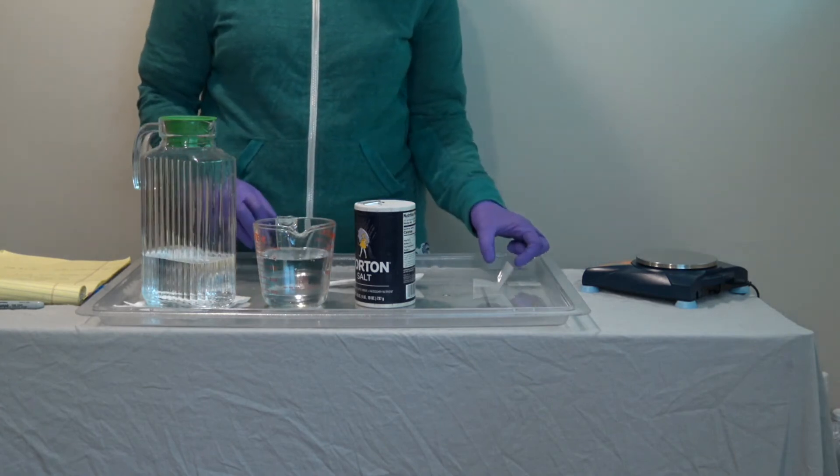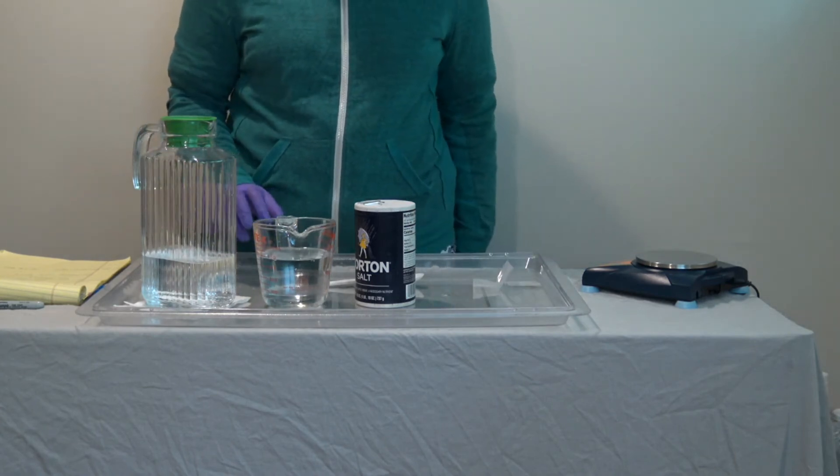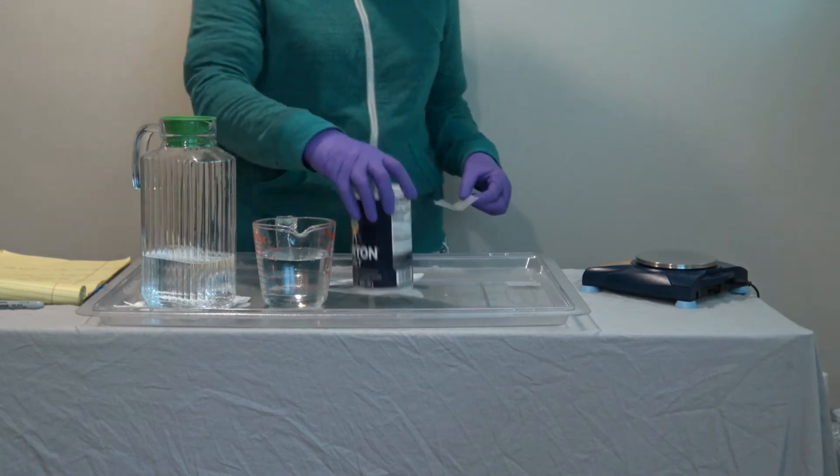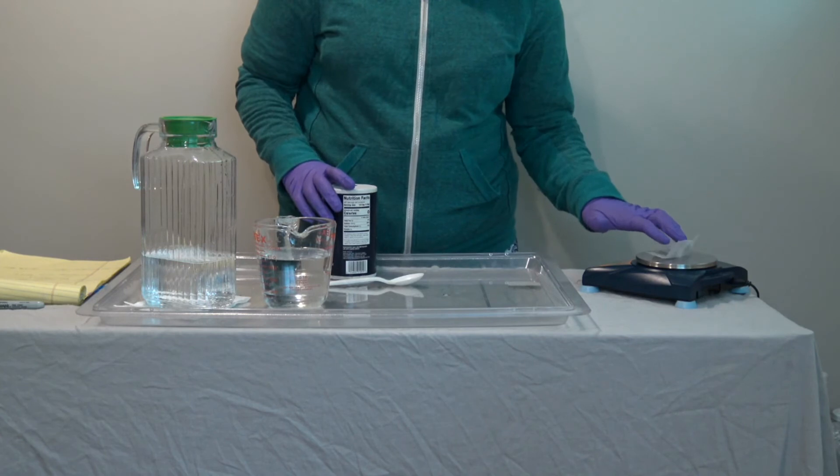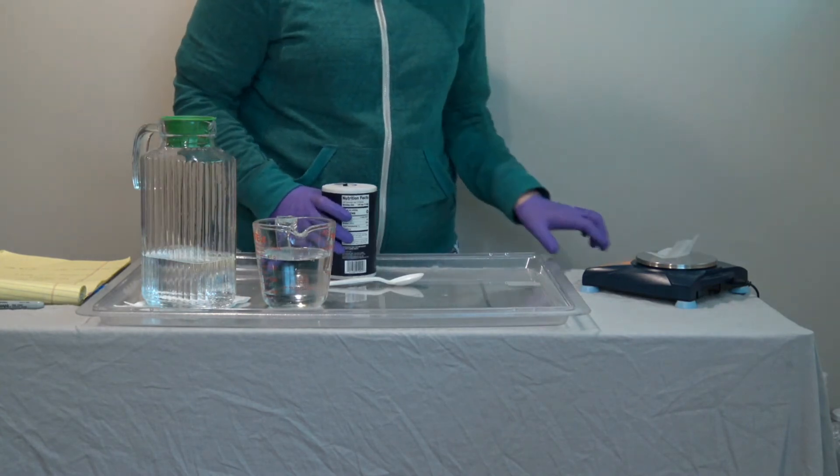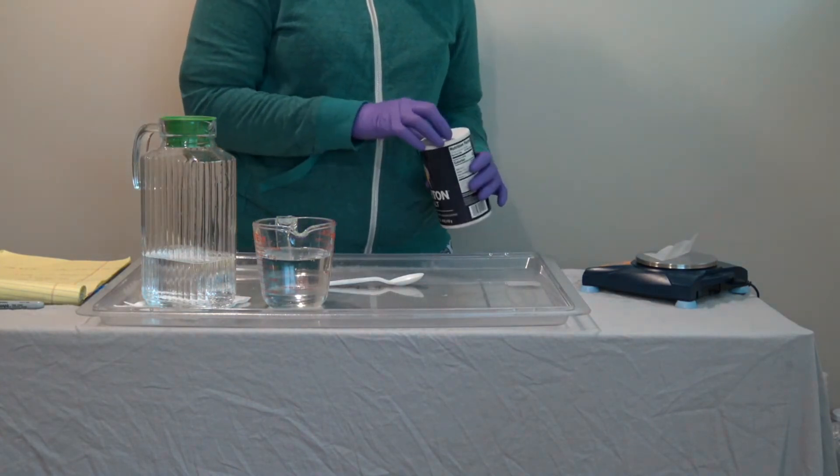Next, I'm going to measure out 2.4 grams of salt. We're just using regular table salt here. I'm putting a piece of parchment paper on my balance. I'm going to tear that.